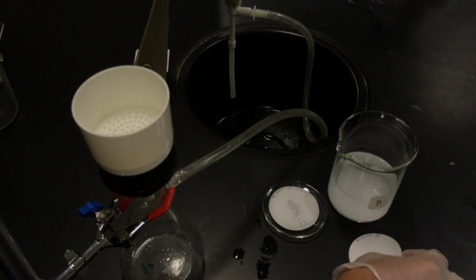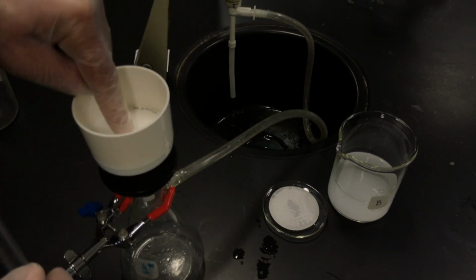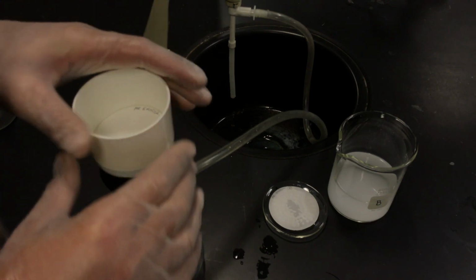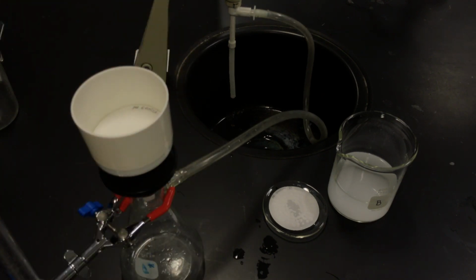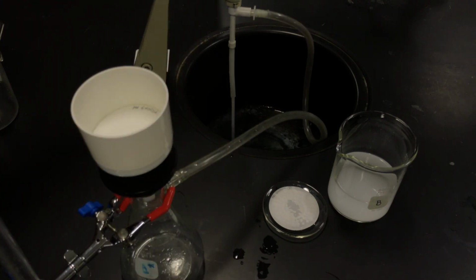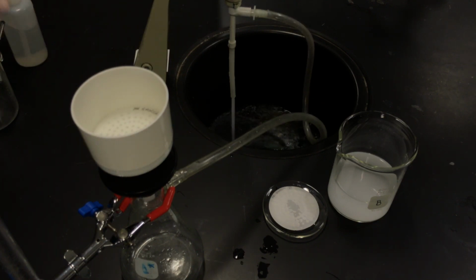So we're going to grab the filter paper for solution B. We have that massed out, dried already. I'm going to put that into the Buchner funnel, and we're going to make sure that my Buchner funnel apparatus here is tight. My vacuum filtration has got a good seal. Turn on the water, create the low pressure situation inside the conical flask. Wet my filter paper so that it seats tightly onto the filter.